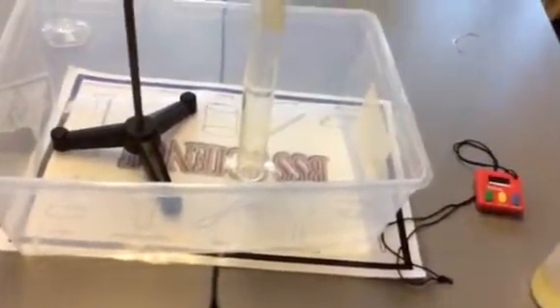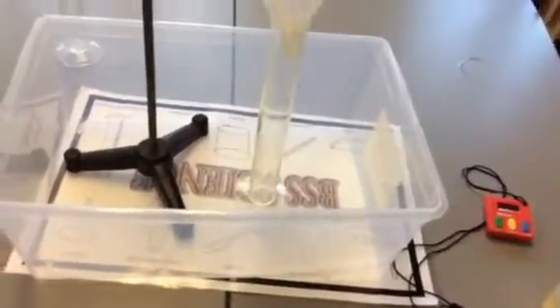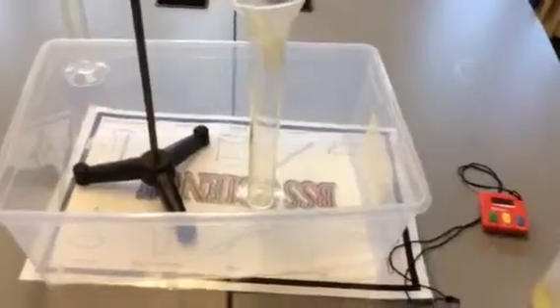So the two variables: the independent variable, the thing that we're manipulating, is the temperature of the oil. So there'll be 6 different temperatures of oil. We as experimenters are manipulating that. So that's why it's the independent variable. This will be the first part of your hypothesis, by the way. And then the second thing that we're measuring is the dependent variable. It depends on the independent variable. We have no idea what that's going to be, but the dependent variable is the time.